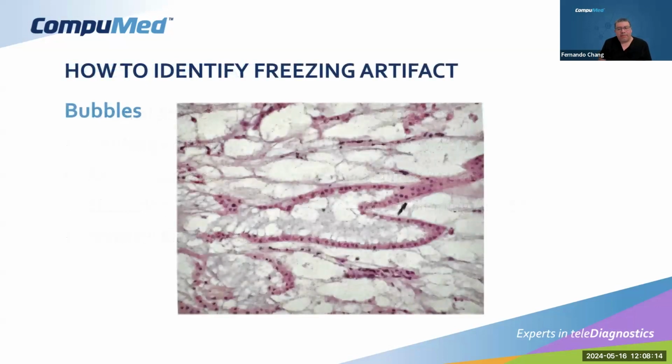So how can we identify freezing artifact? There are subtypes of freezing artifact. Like in this slide, we can see these spaces between the layers of tissue, and you can see these little small holes and big holes. Now the cells of the layering are quite intact, but you can see these spaces that simulate bubbles.